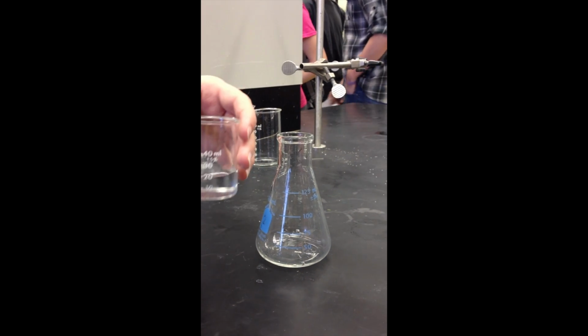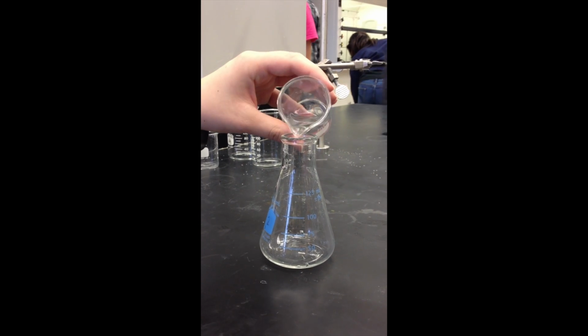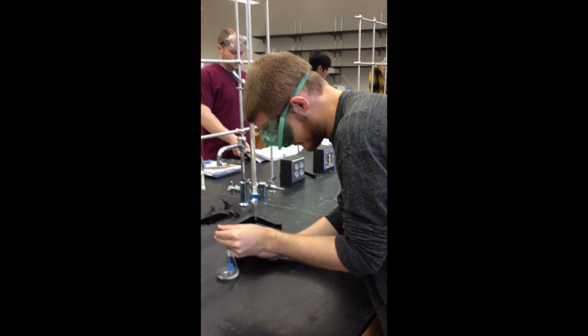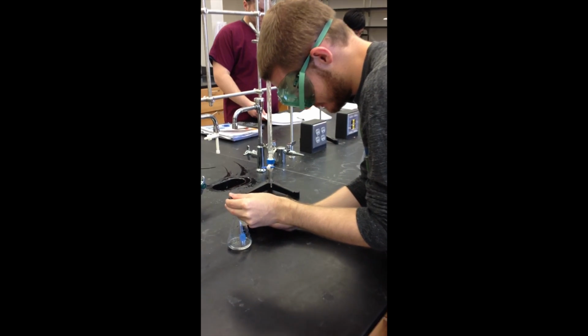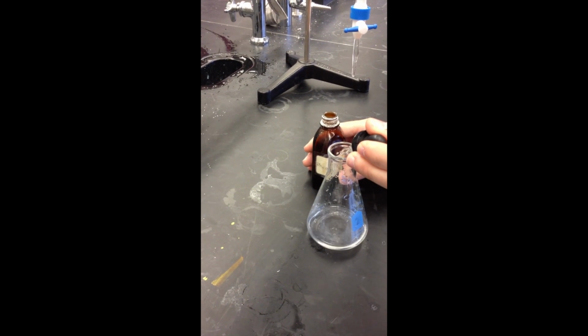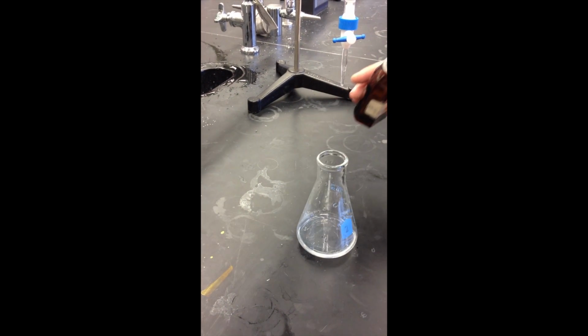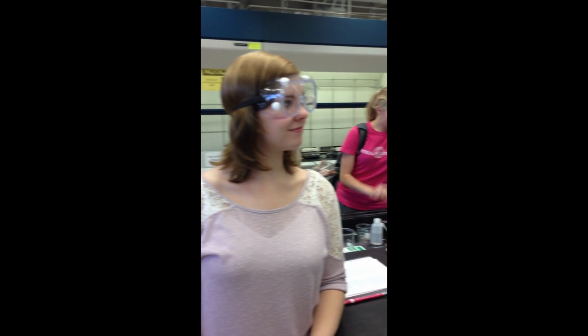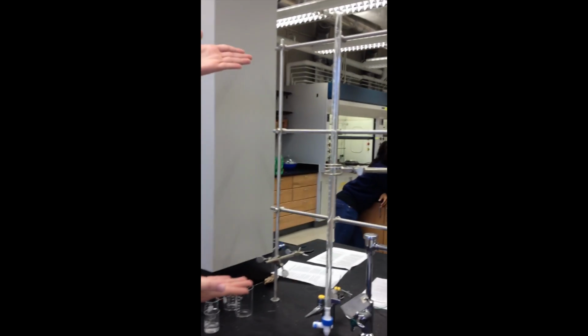We are adding 20 milliliters of citric acid to the flask. We are now adding a few drops of the indicator solution. We add 50 milliliters of sodium hydroxide to bring the burette to 0.